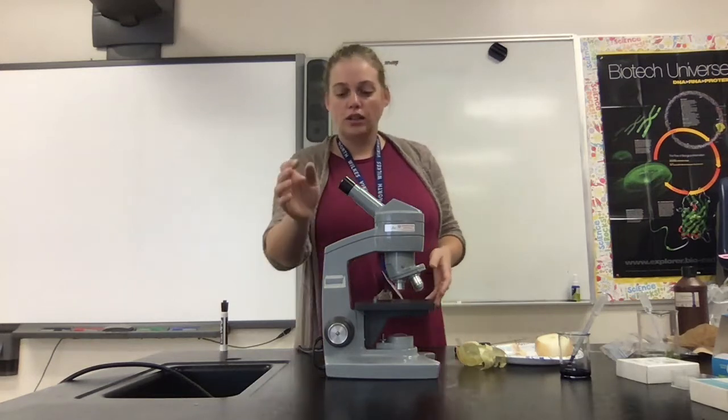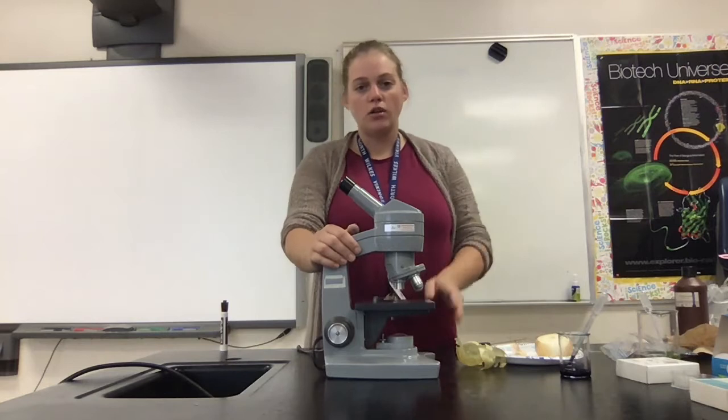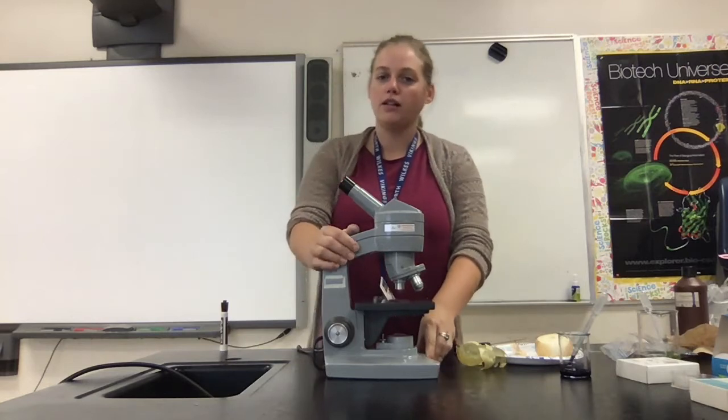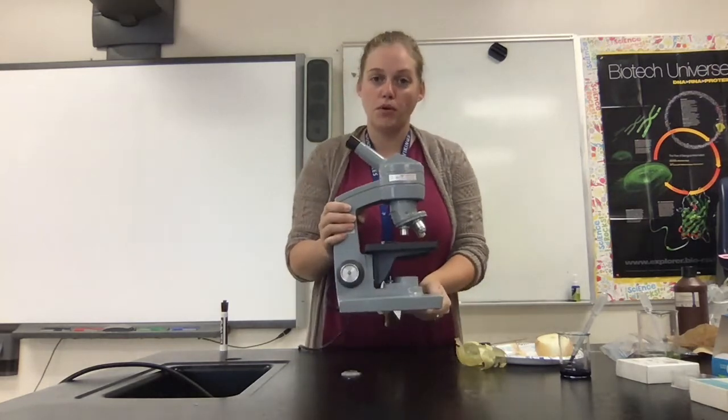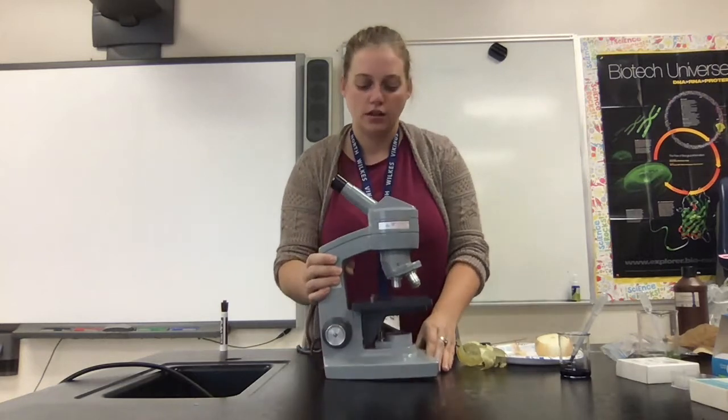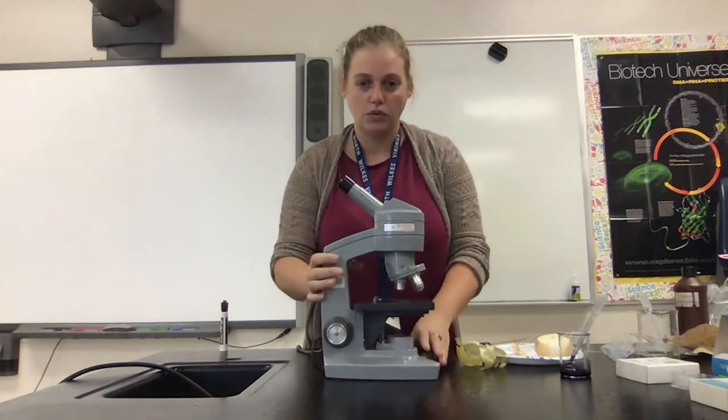All scopes are going to have an arm and a base, and this is how we're going to carry the microscope. You pick it up with both hands by the arm and the base. They're very expensive, so we want to make sure that we don't drop them and damage them.